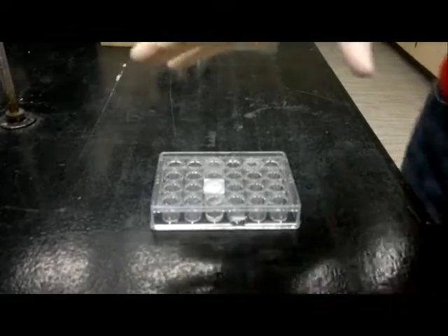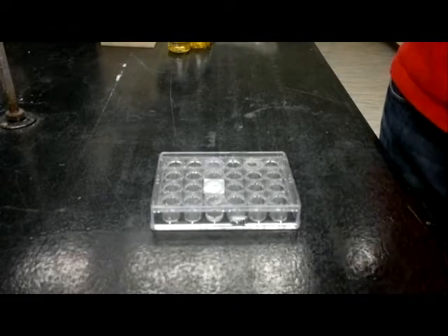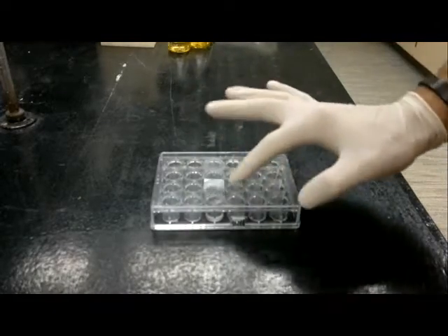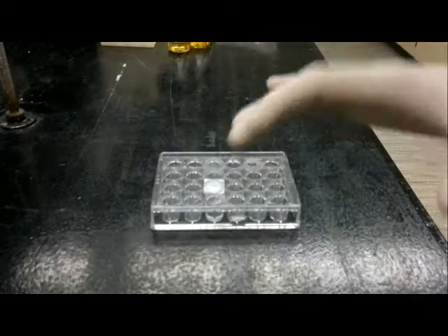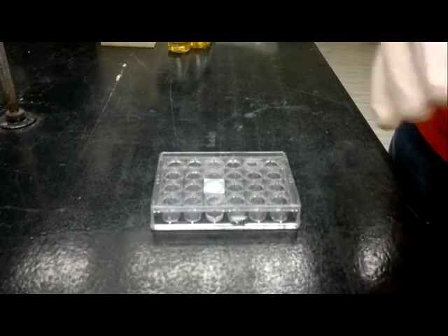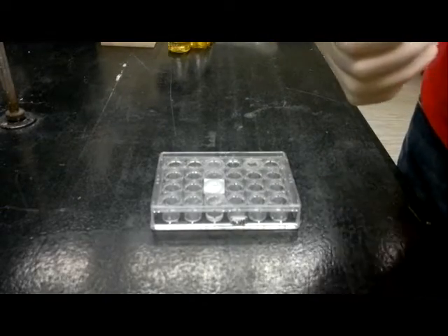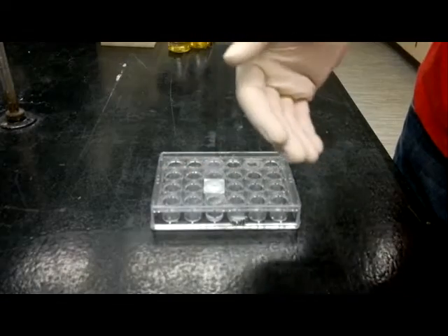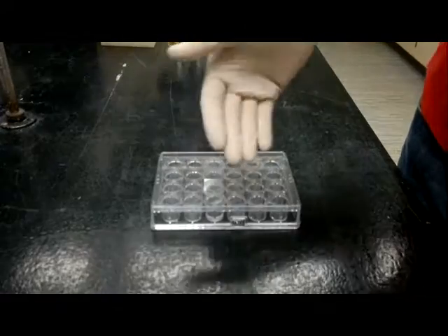The second part of the crystallization experiment is basically taking images of your crystals. Now, by looking directly at the cover slips, you can sometimes see whether there are small crystals that have formed. But it's a lot easier and a lot more certain that they're protein crystals if you've done your methylene blue. But do you want to take all 24 of your cover slips off, add methylene blue and wait? Some of these will not have any crystals in them at all.